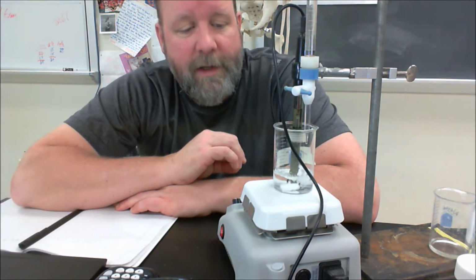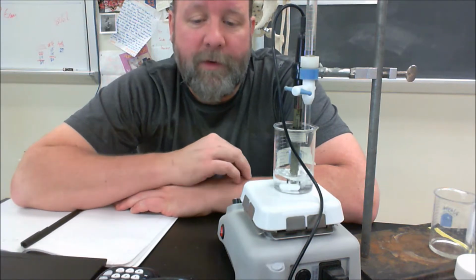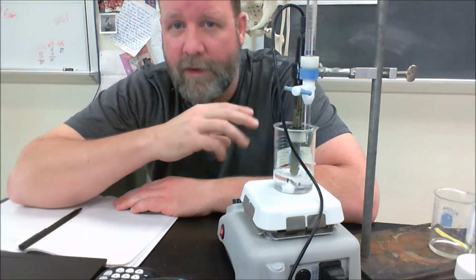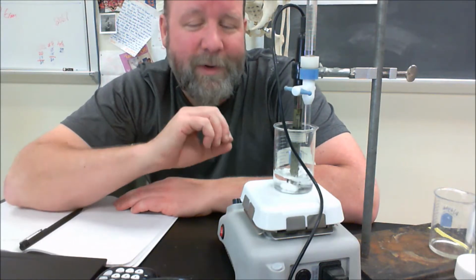So as I add the sodium hydroxide, I'm going to make a buffer solution. I'm going to produce more acetate ions, and I'm going to reduce the number of acetic acid. So if you remember our David Hasselhoff equation, pH equals pKa plus the log of the concentration of the conjugate base over the concentration of the acid. I want to get that log of the conjugate base over the acid. I want to get that to 0.